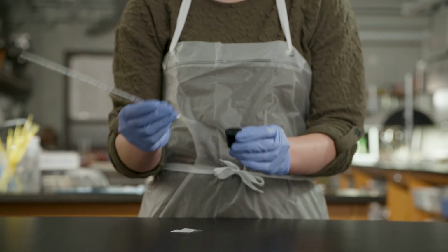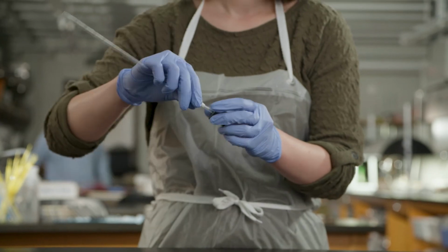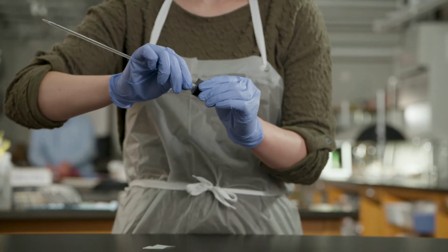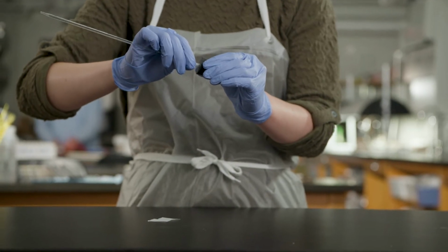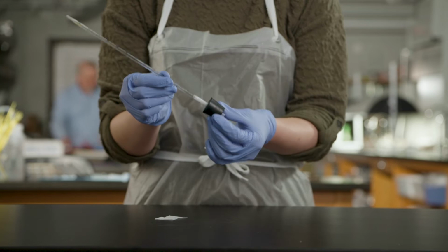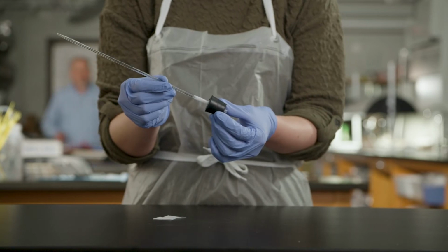Holding the pipette by the wrapped section, carefully insert the blunt end of the pipette through the hole in the stopper. Do not shove the pipette into the stopper abruptly or hold the pipette too far from the stopper, as this may cause the pipette to break and cause cuts or puncture wounds.